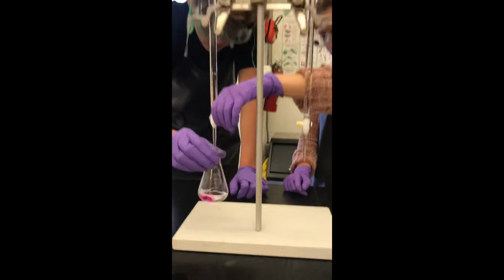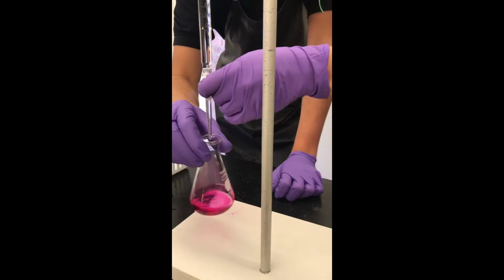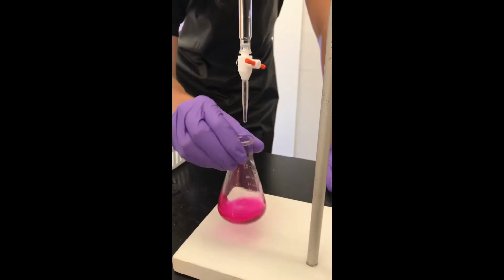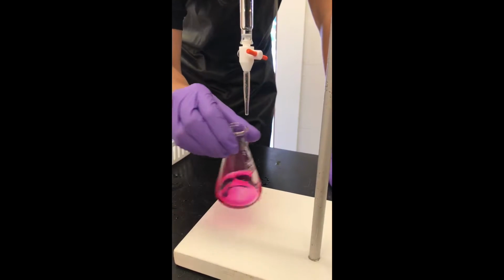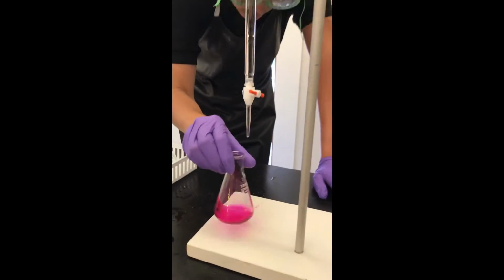The pink color of indicator faded with swirling. When pink color stayed for longer periods of time, the base was then added drop by drop. The equivalence point was reached when a light pink color remained after 30 seconds of swirling.